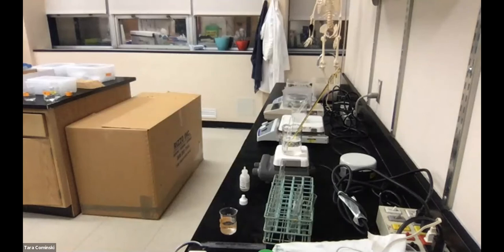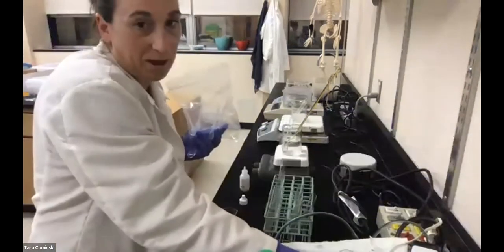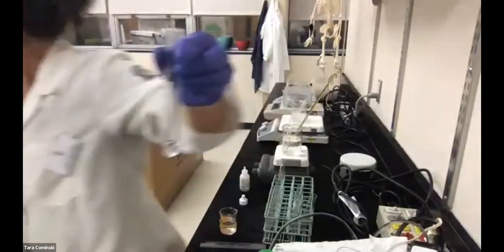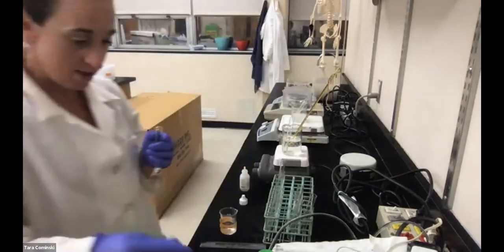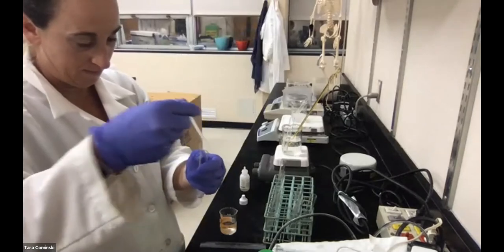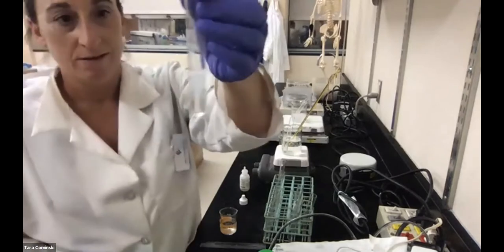I'm going to switch to a transfer pipette, guys. One second, that's not going to work out for me here. Instead of using that serological pipette, I'm just going to switch to a transfer pipette because I'm making a big fat mess here. So tube 2, this is on page 59. We're going to put water. I put water in there, and then now I'm going to put hydrogen peroxide, okay? This is actually easier. All right, so there you go.